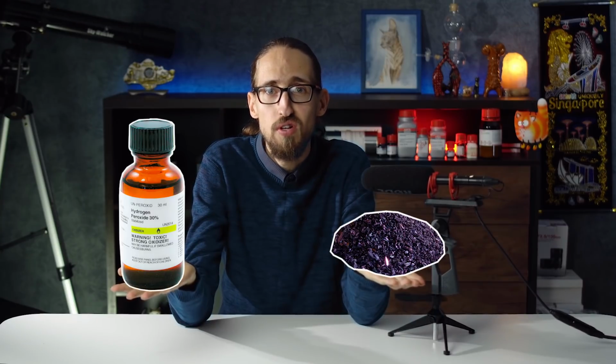Hey guys! Among all the chemical reactions that you can find on YouTube, the reaction of potassium permanganate and hydrogen peroxide is the most popular one. As a self-respecting YouTube chemist, I will not show you that elephant toothpaste reaction. Instead, I'd love to show you the slow-motion footage of potassium permanganate and hydrogen peroxide interaction.